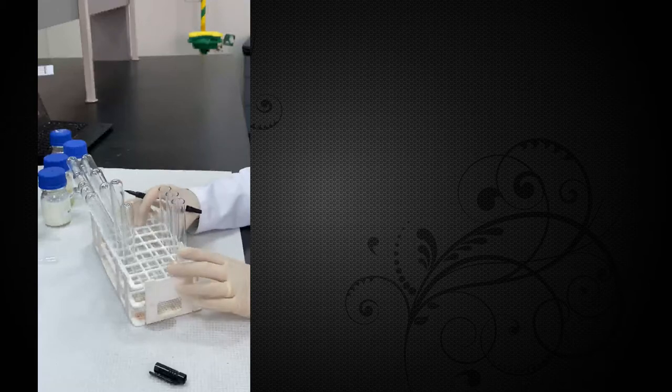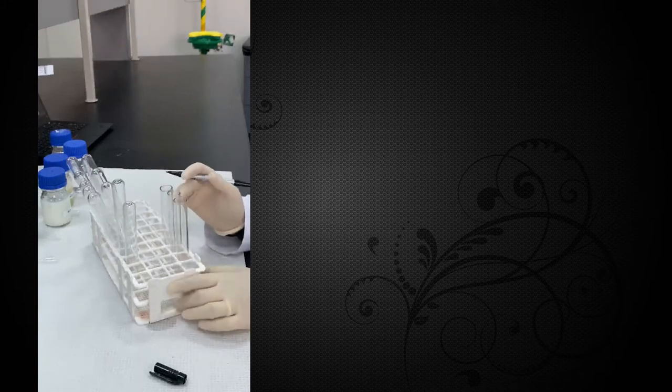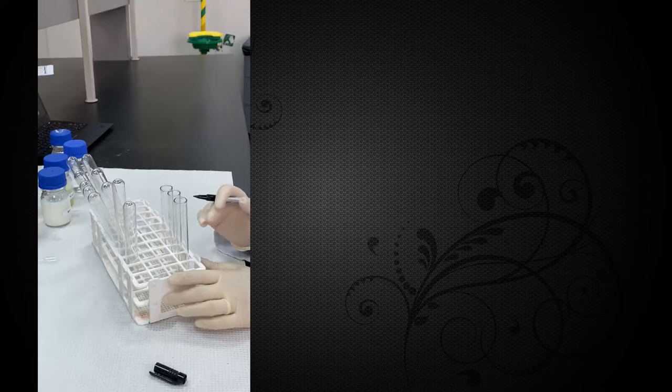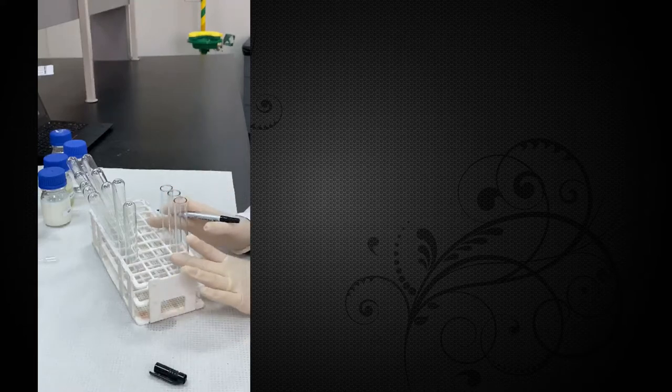The first test that we will start with is the Biuret test. It's a test of polypeptides. It will identify for you if you have polypeptides or protein inside the test tube. This is not a test for amino acids, only for peptide bonds.